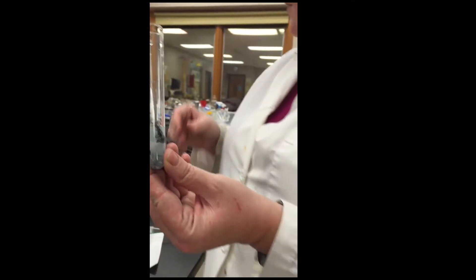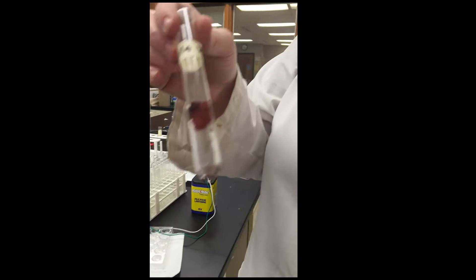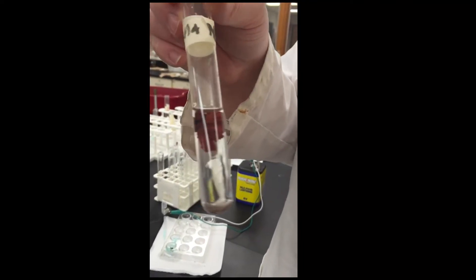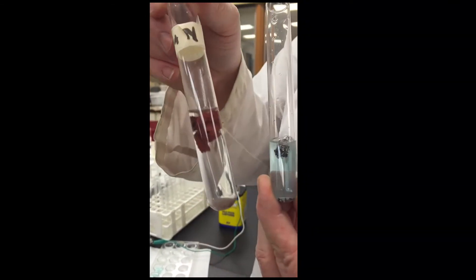I'll let that keep going for a bit and bring one of the reactions over that took place. This has been sitting overnight. You can see the copper metal formed. This is what this one will end up looking like eventually.